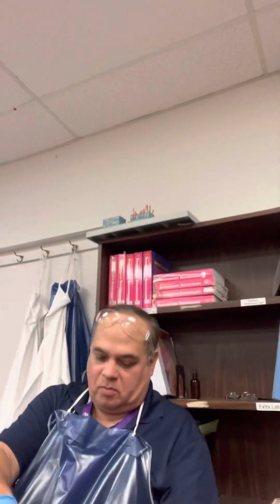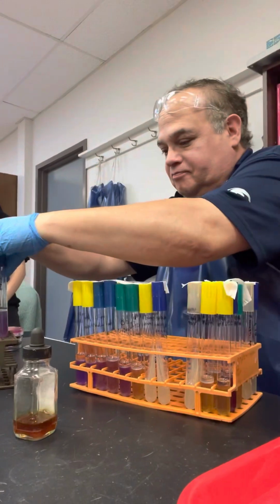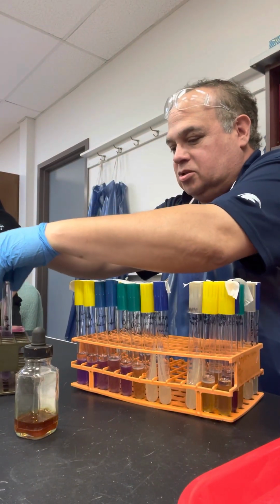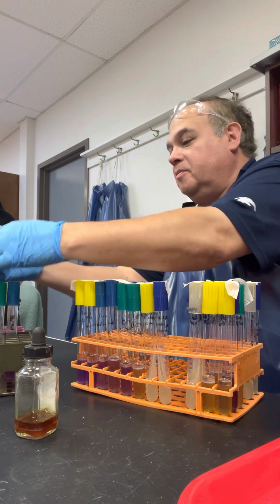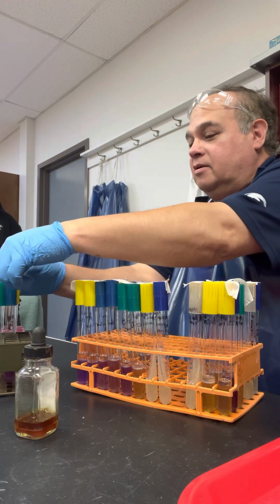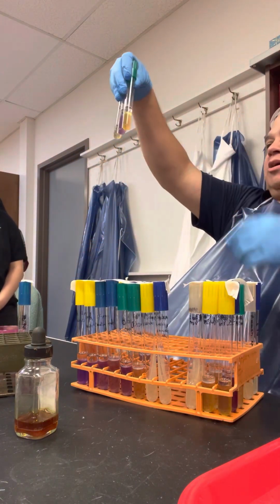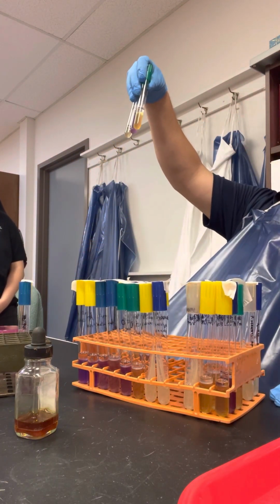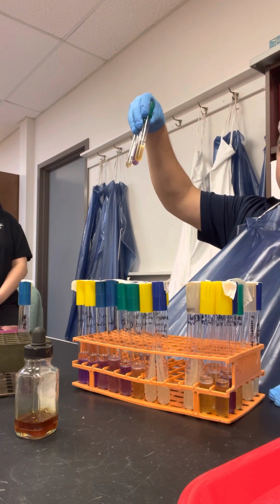Finished. And so the decarboxylase test appeared to work really well. Let's use the middle one here. This is from group four. Y'all did well, thanks. So first of all, are these valid tests? Yes. And which one of these is positive? The middle one. The other two are negative.